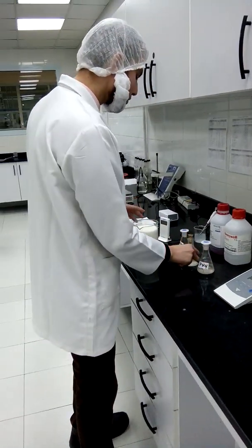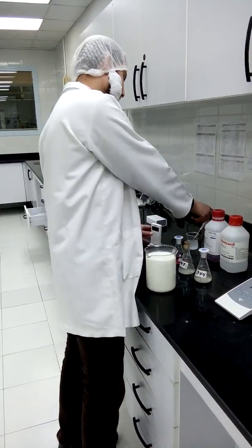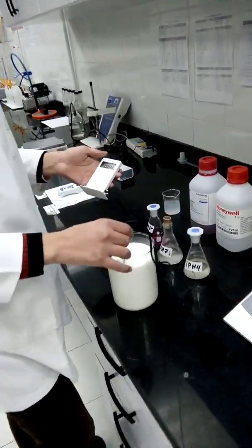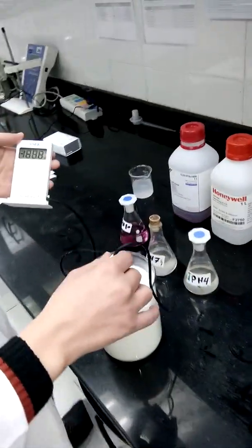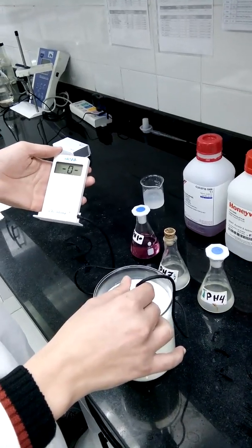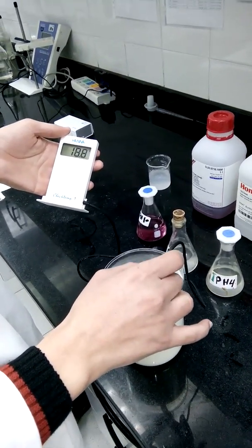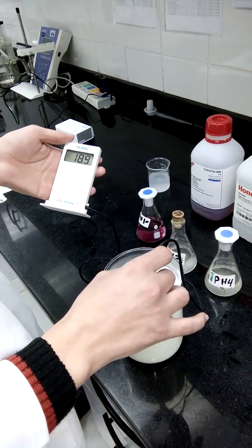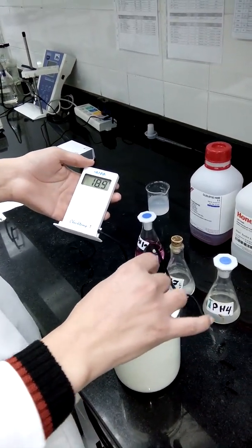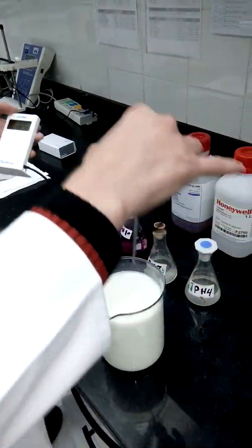I have to make sure that our sample temperature is normal, because high temperature makes hydrogen ions move faster and the reading will not be accurate. The temperature is about 19 degrees centigrade.